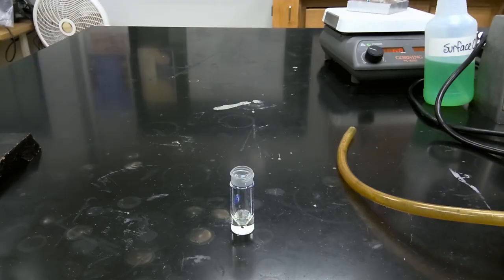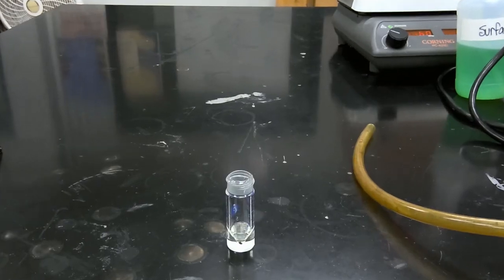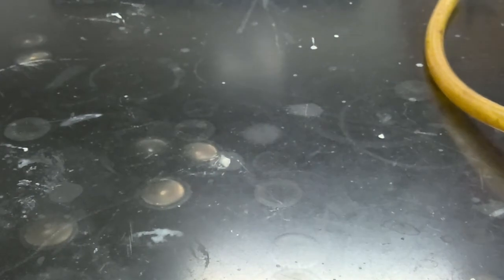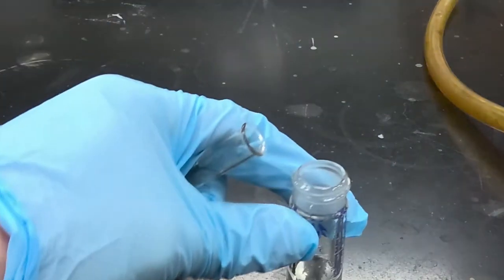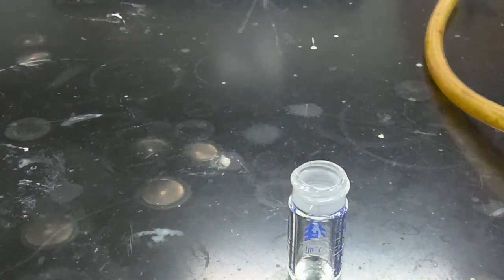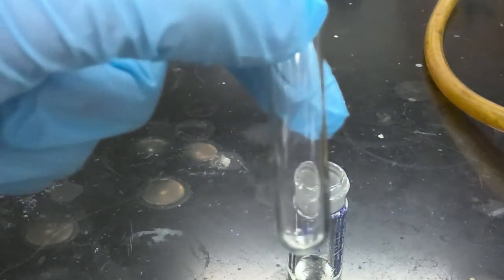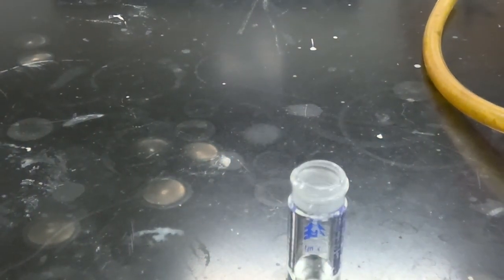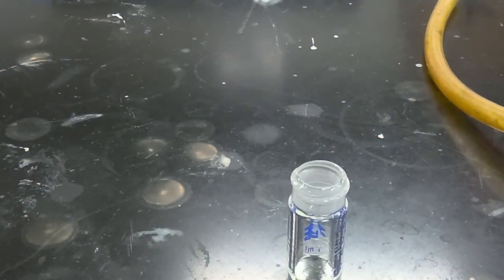Okay, so we're going to do some solubility tests now. So what we're going to do is take a small volume of our product. And you know what's really funny is that the product has a very characteristic smell. Unfortunately, you can't observe through a recording what something smells like.